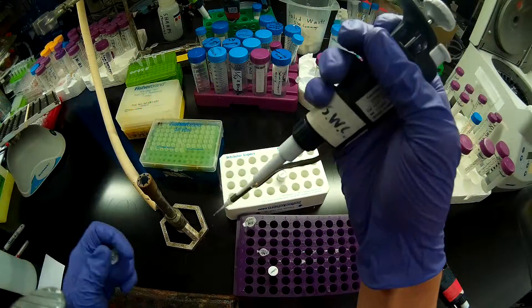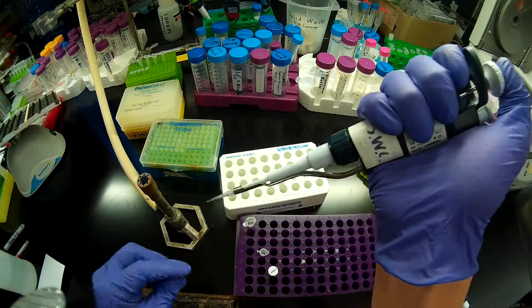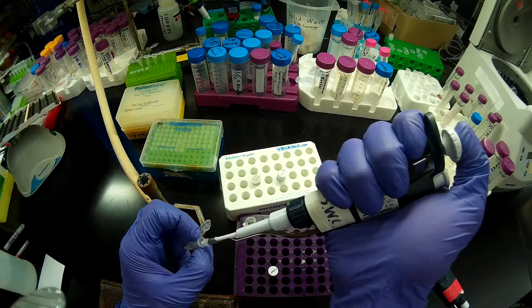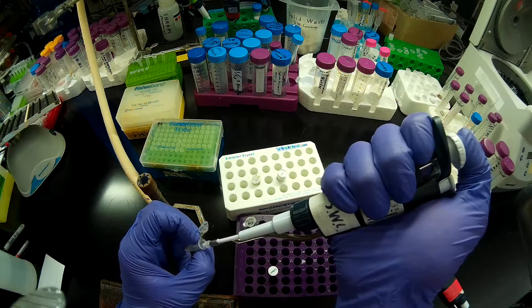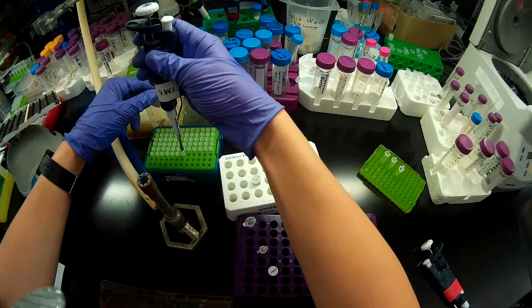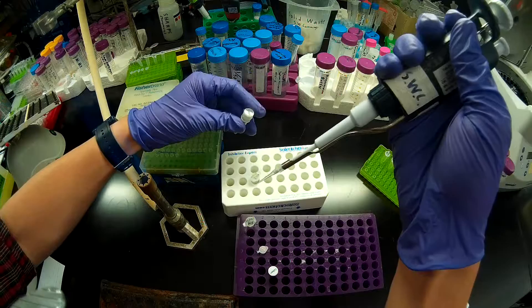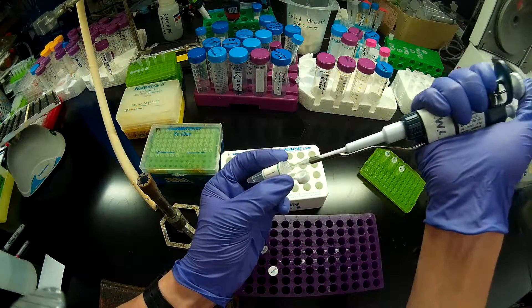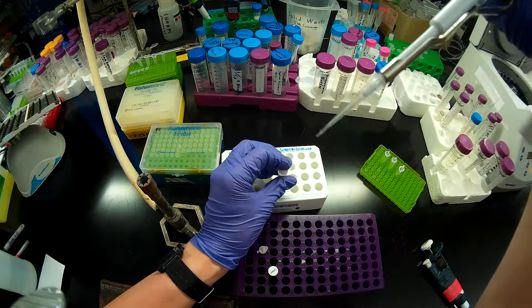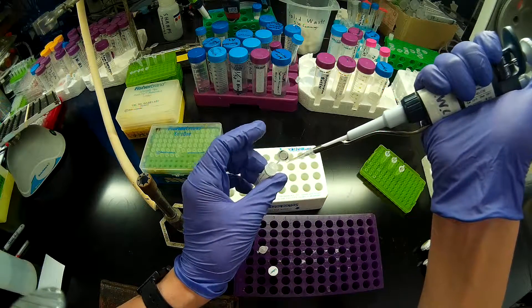Since these enzymes are expensive, we want to make sure we're not getting any dust or anything in there. One thing to bear in mind is these enzymes are stored in a glycerol solution, so it's pretty viscous. If you dip your pipette in a little bit too deep and pull it out, you'll have a bunch of enzyme glopped on the outside of the pipette tip. You want to wipe that off before you put that pipette tip into your reaction to dispense the enzyme.